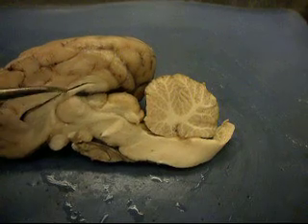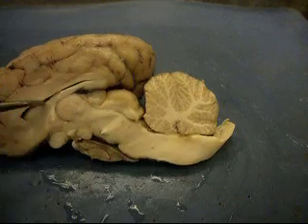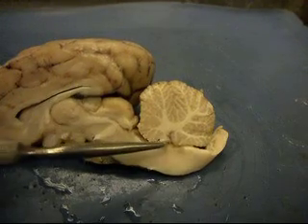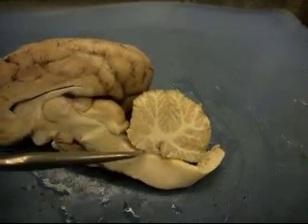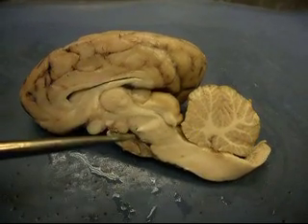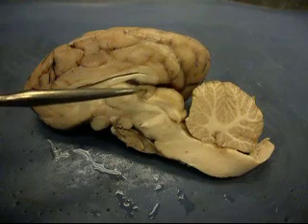Corpus callosum. The inside is the lateral ventricle. I'm going to show you the fourth ventricle — this area right here. And this is the pineal body right here.